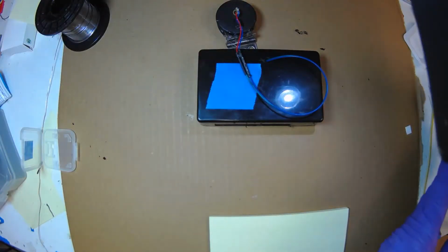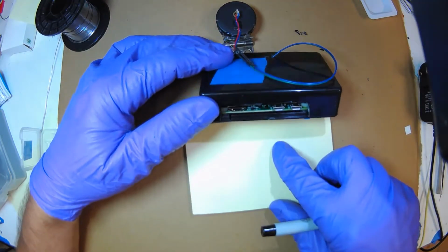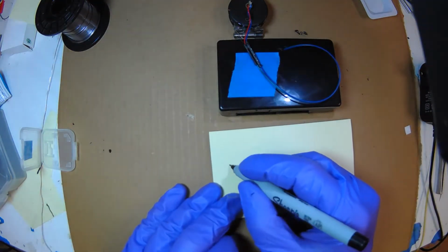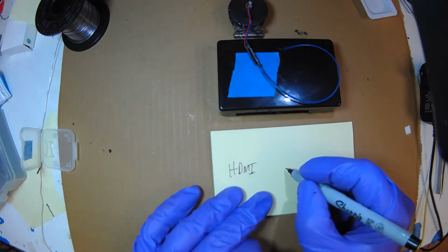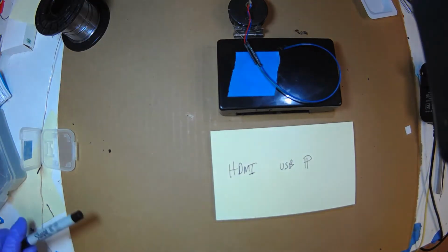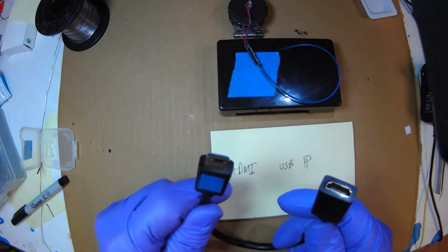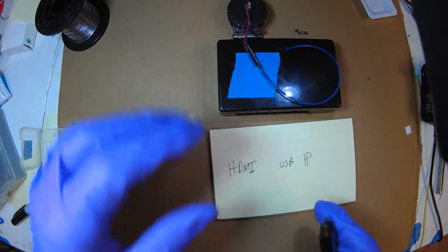Okay, so here's how we wire this up. We have 3 connectors: HDMI, USB, and power. Now these are all mini, so we need a lot of adapters. This is a mini HDMI to normal HDMI. So let's plug that in.